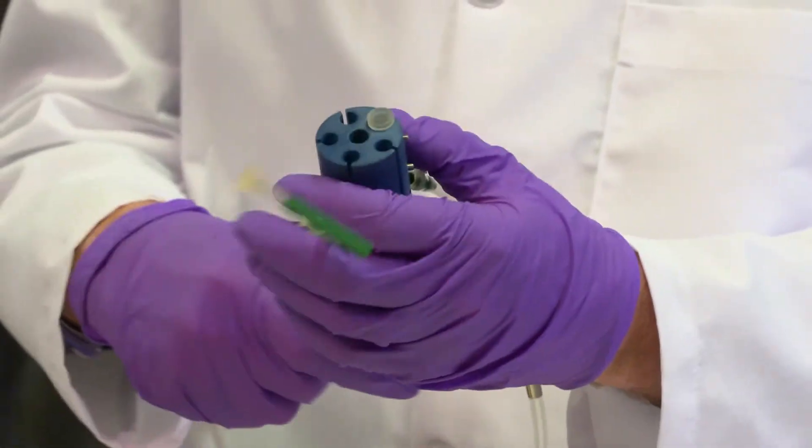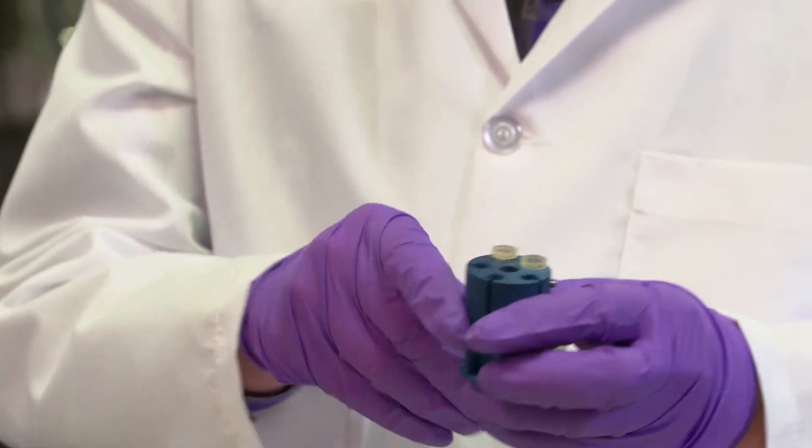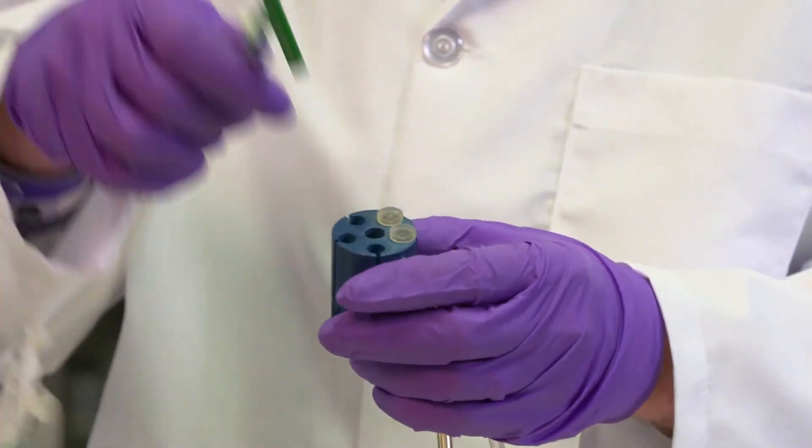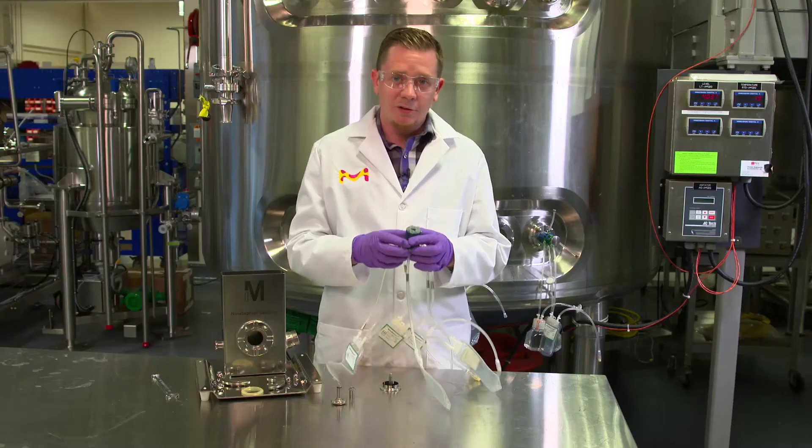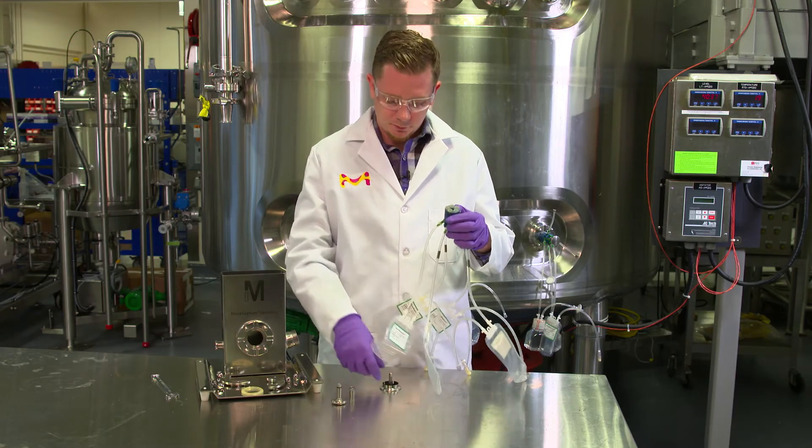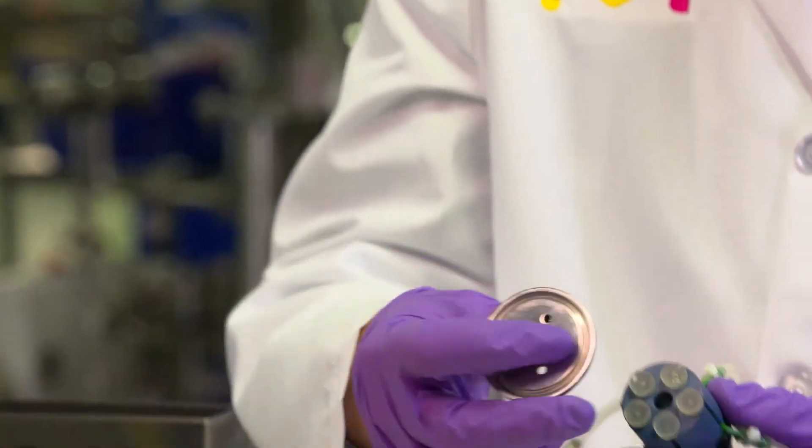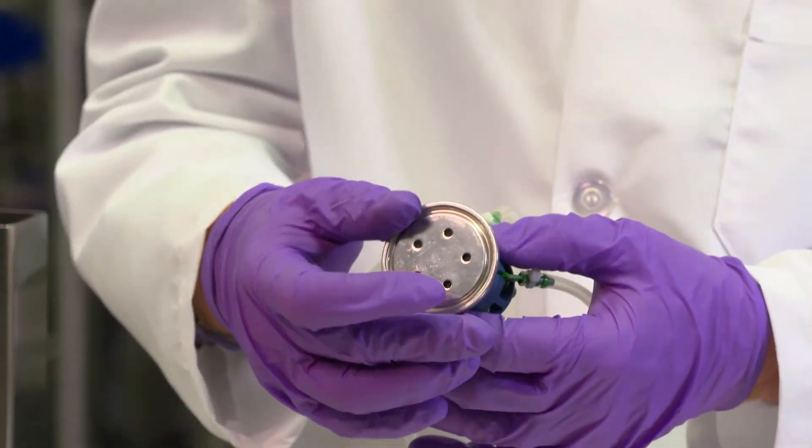We want to make sure to fill all five of the holes so that we're not going to leak from our tank into the clean room. Once all five of the containers are loaded up, we take our stainless steel base and tighten it down with the locking nut.